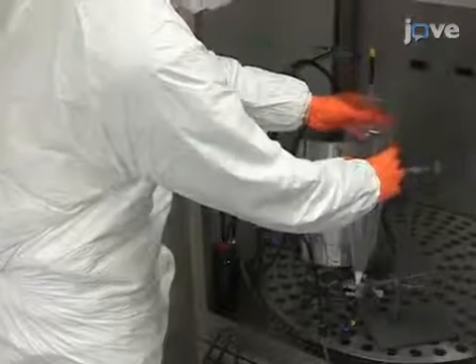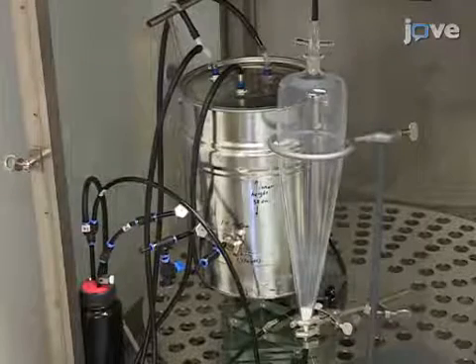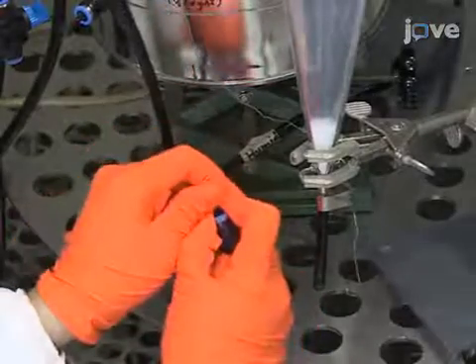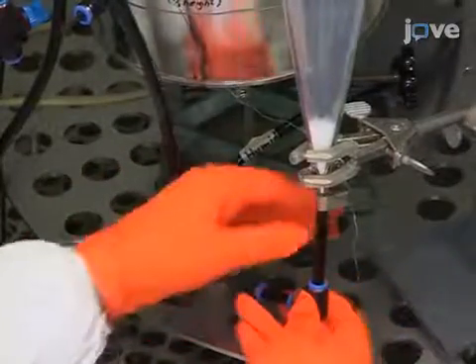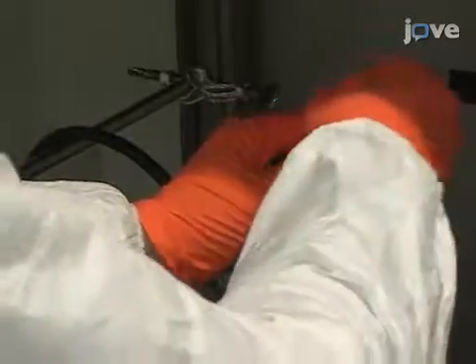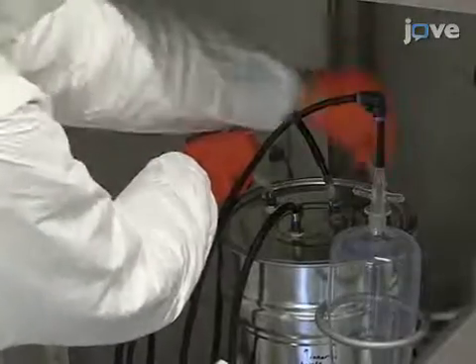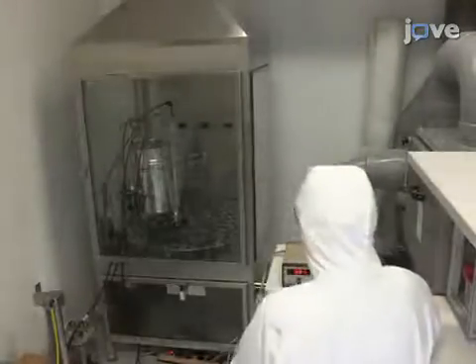At this point, the aerosol generator is in place in the ventilation chamber. It is in a vertical standing position and is supported by a metallic scaffold. At the bottom, remove the block to the inlet of the generator, then undo the connection between the inlet and outlet tubing. Connect the inlet tubing from the filtered air supply to the bottom of the generator. At the top of the generator, remove the block and connect it to the tubing leading to the mixing chamber. Next, move to the setup exit and remove the block there, then prepare to start the aerosolization flow at the flow tuner.